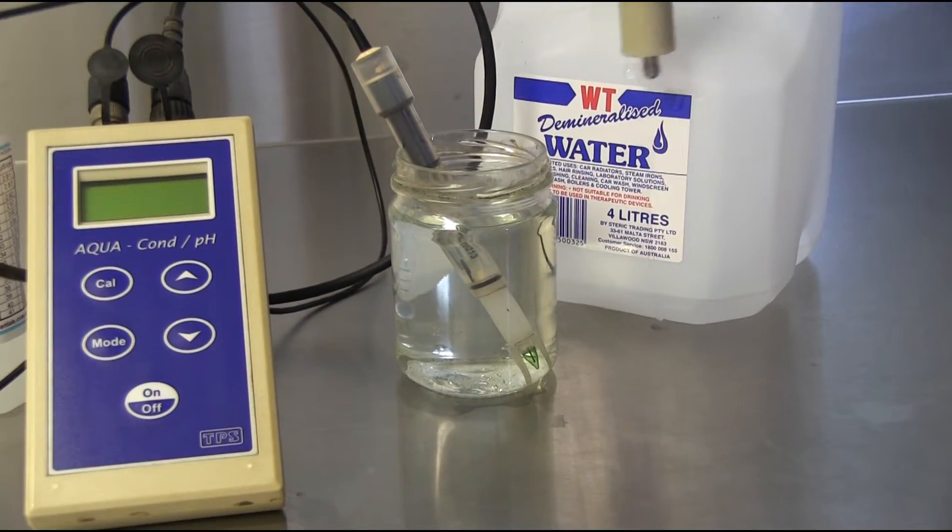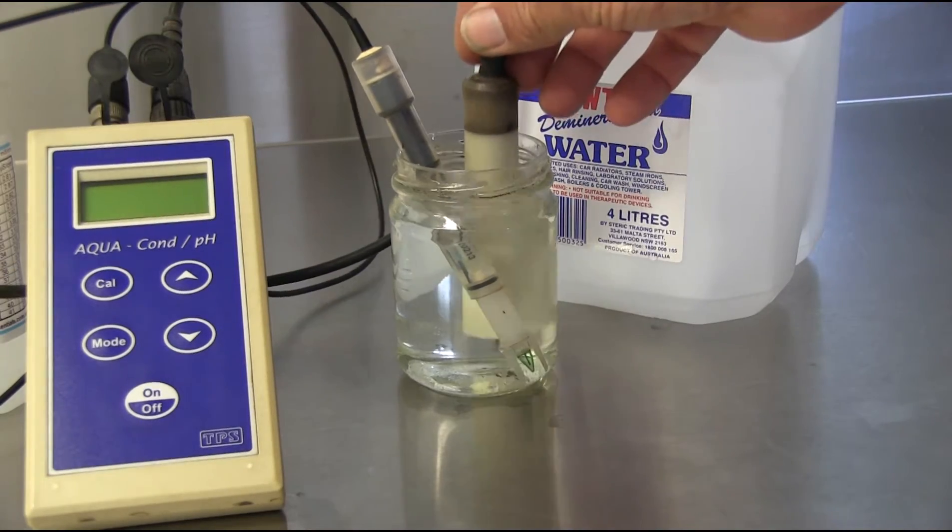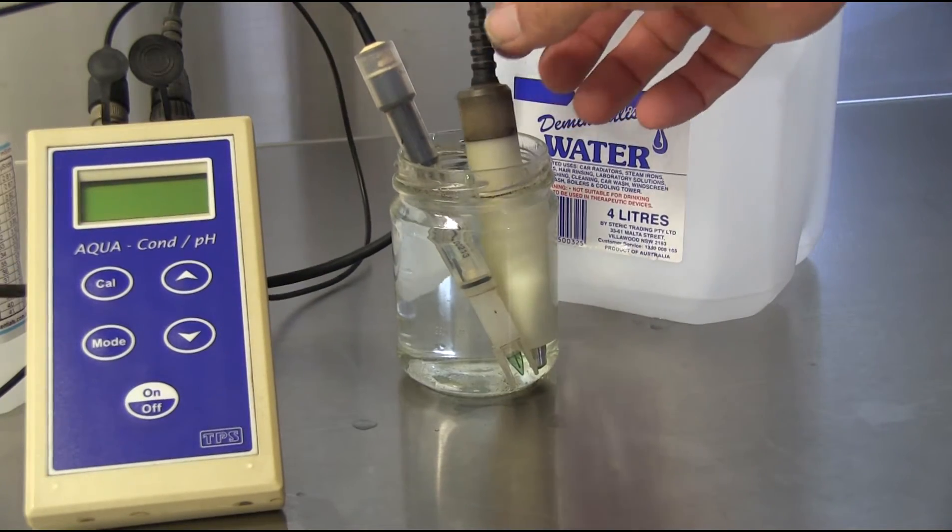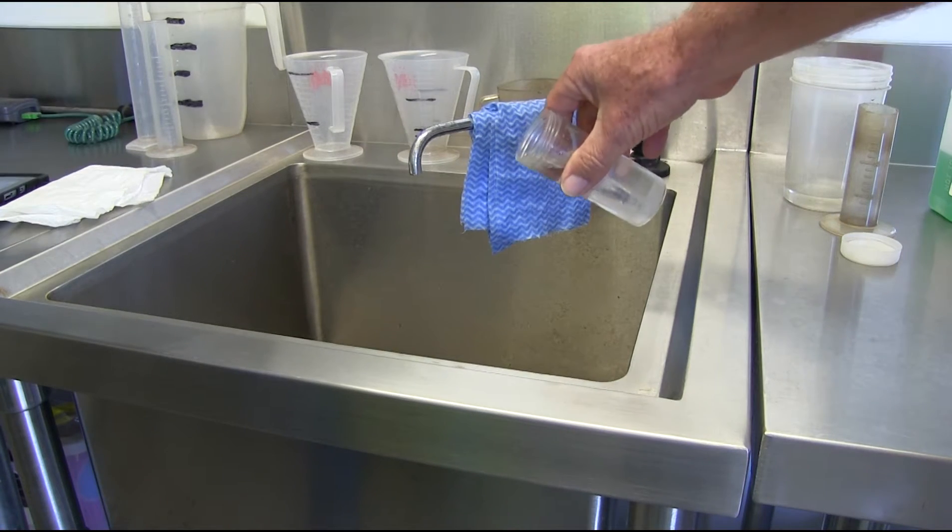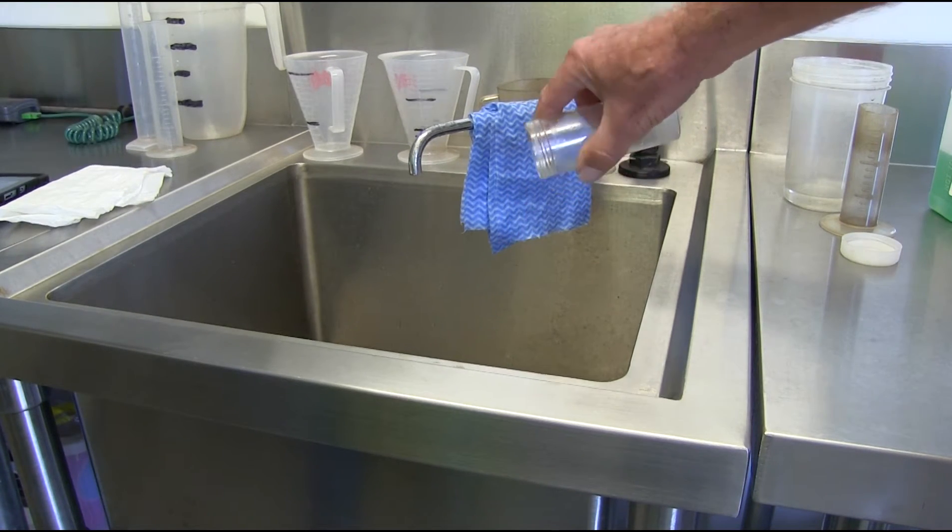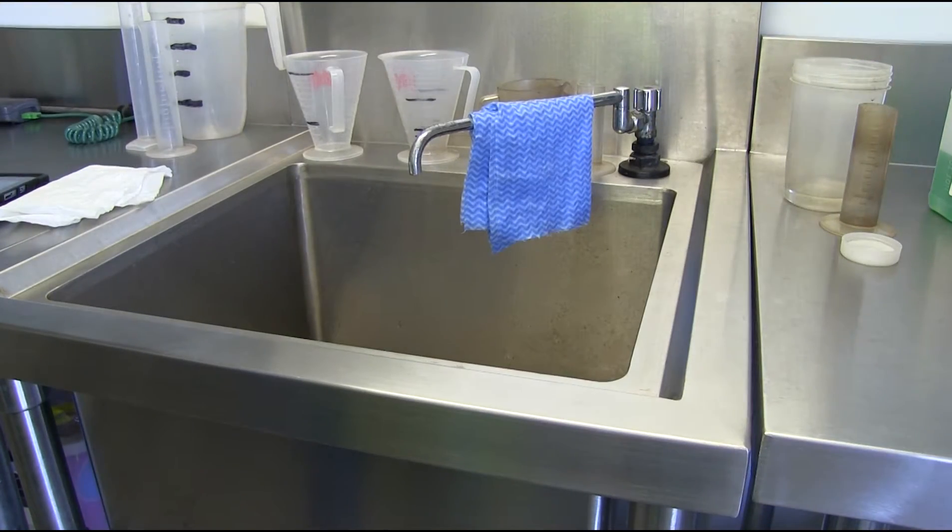To prevent salt buildup on the sensor, rinse the sensor with distilled water after calibration. Discard the calibration solution. Do not pour the remaining solution back into the original bottle, as this will contaminate the calibration solution.